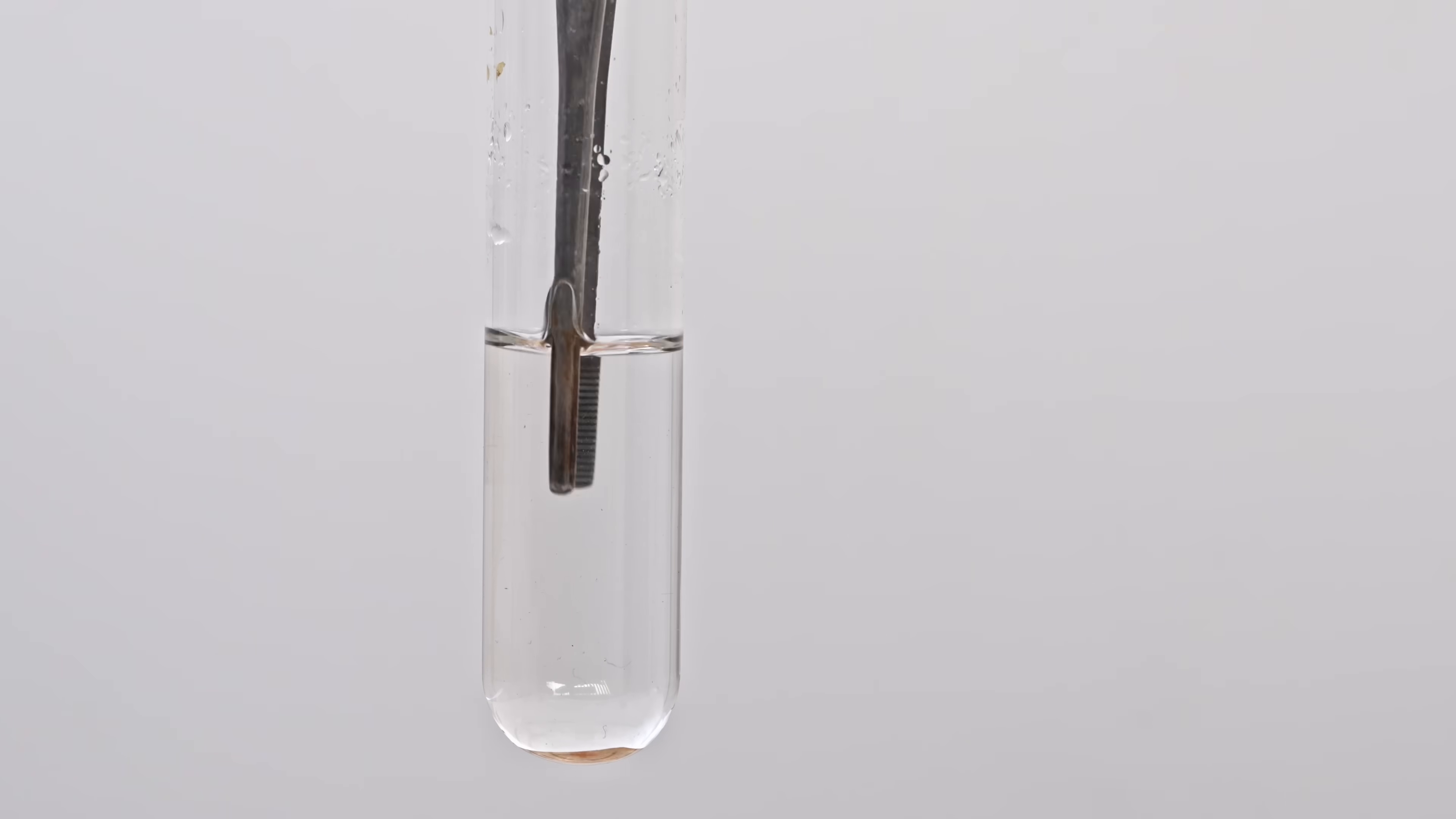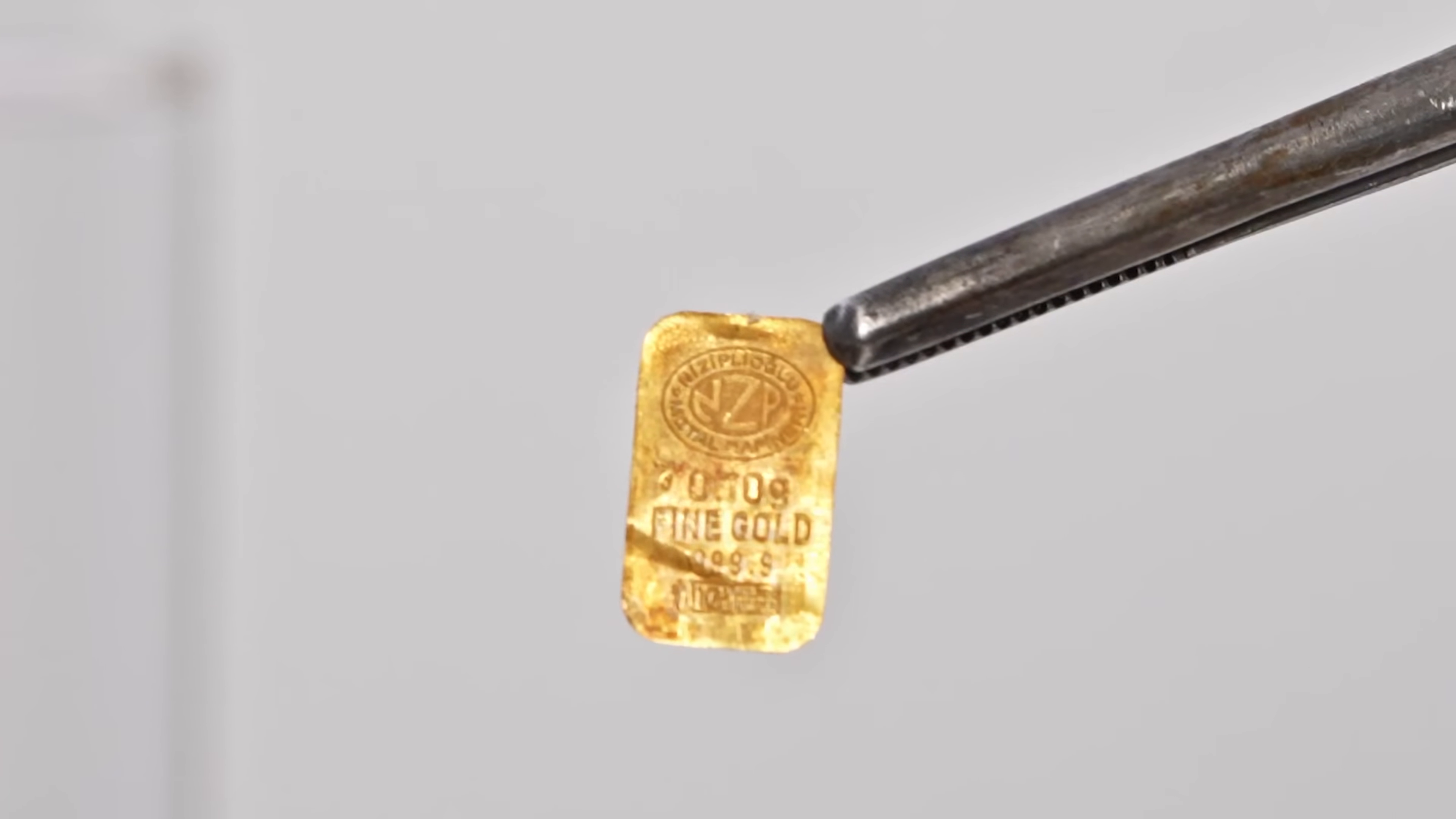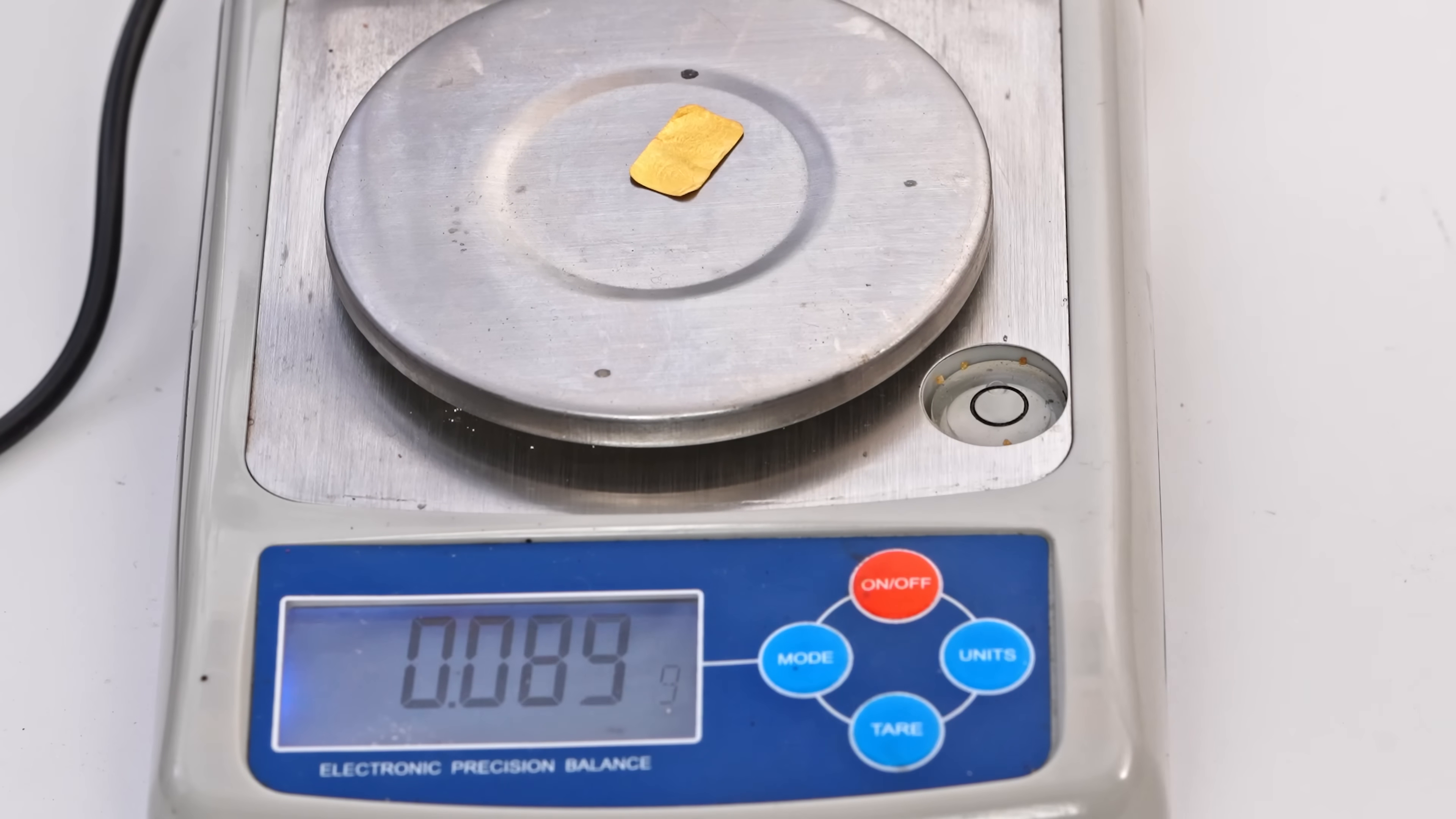After 30 minutes, I remove the ingot and weigh it. Judging by the scale readings, we managed to dissolve 38 milligrams in half an hour.